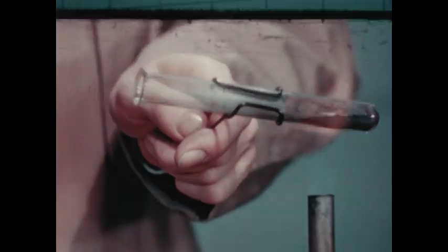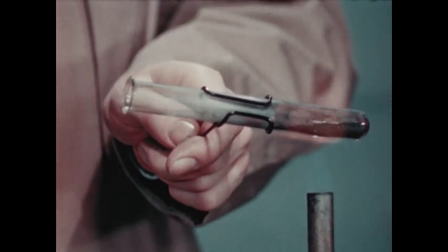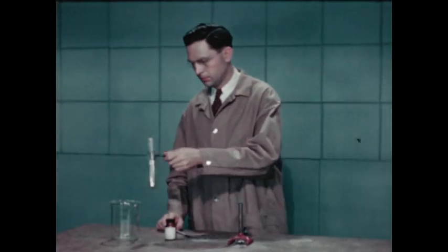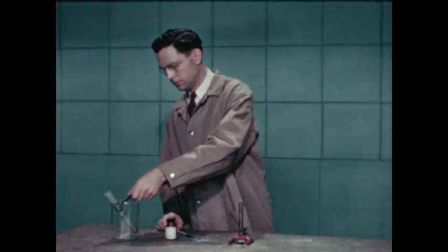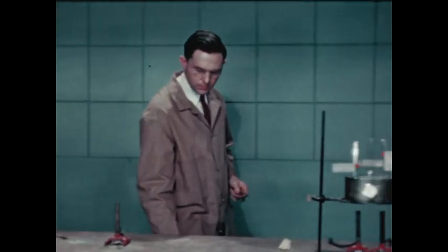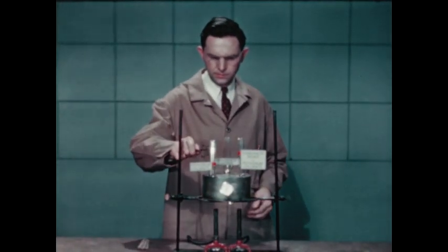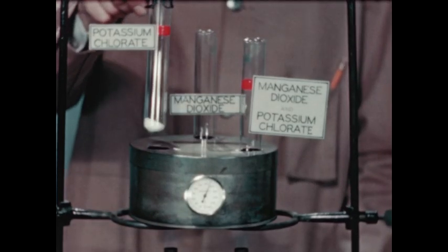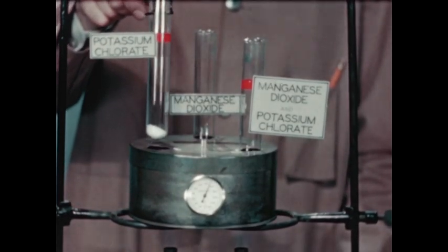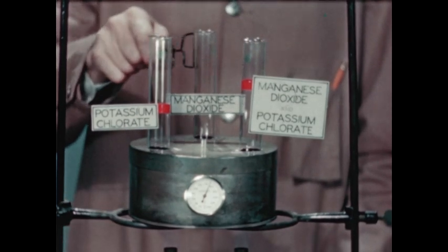When we test, we are sure that's oxygen. We have experimented with a typical oxide — a compound of oxygen and just one other element. Now let us examine a more complicated compound called a salt. Here is potassium chlorate, a compound composed of three elements: potassium, chlorine, and oxygen.